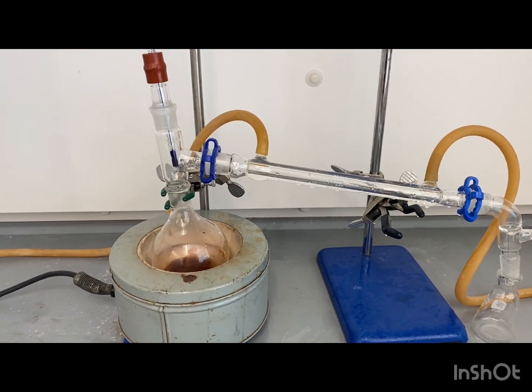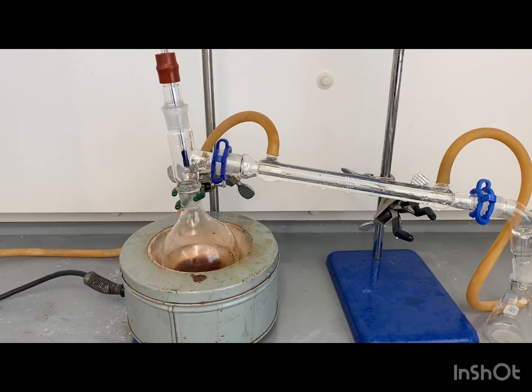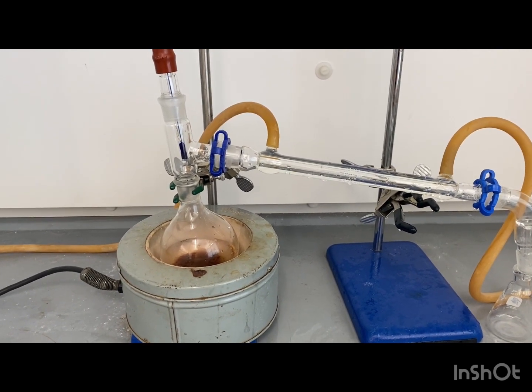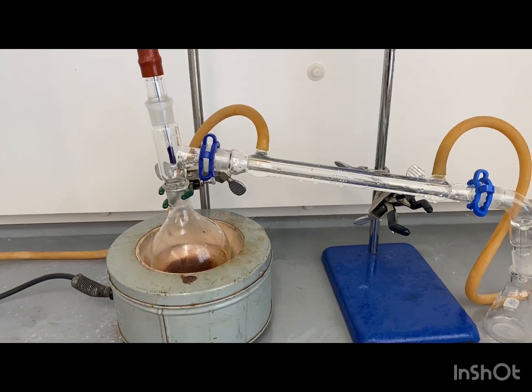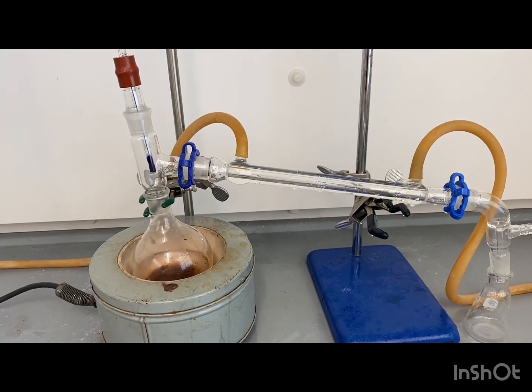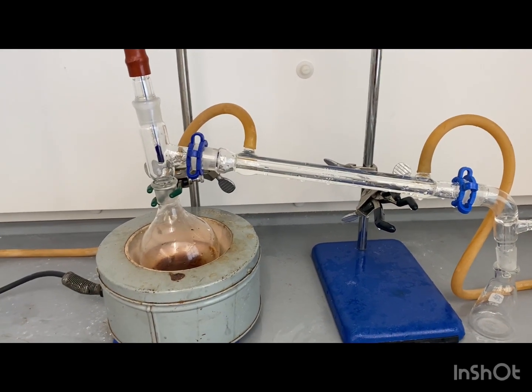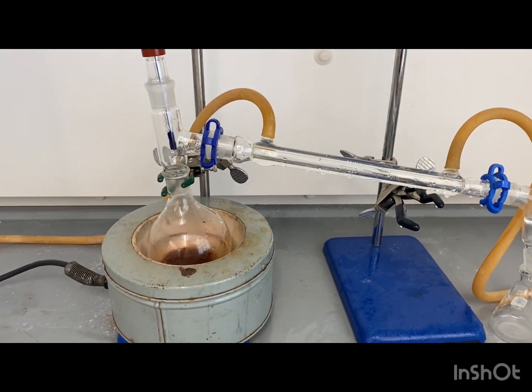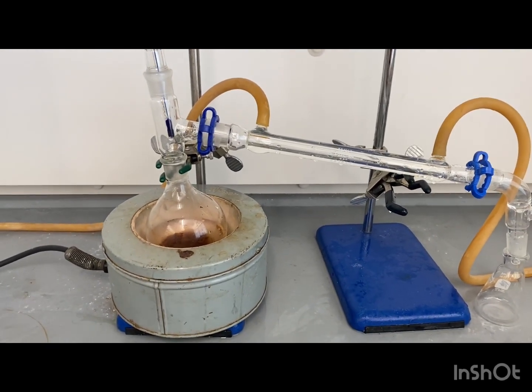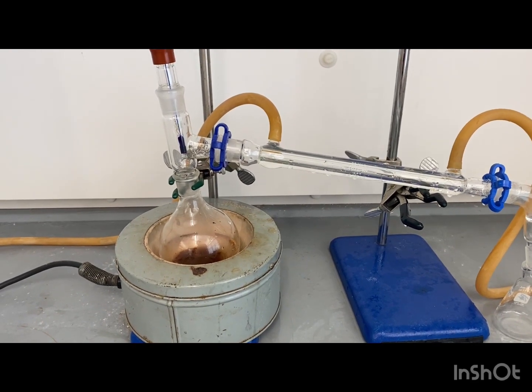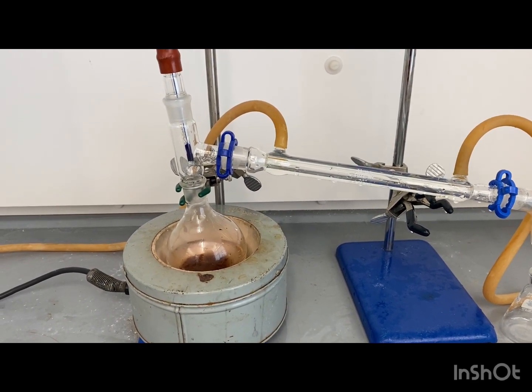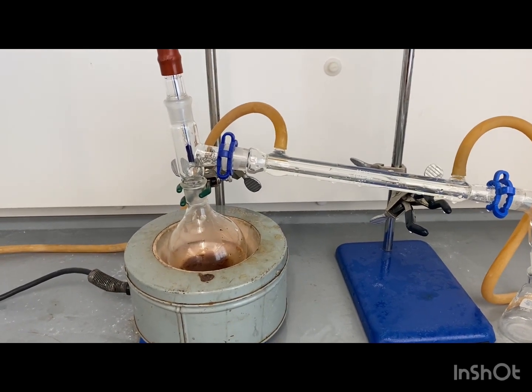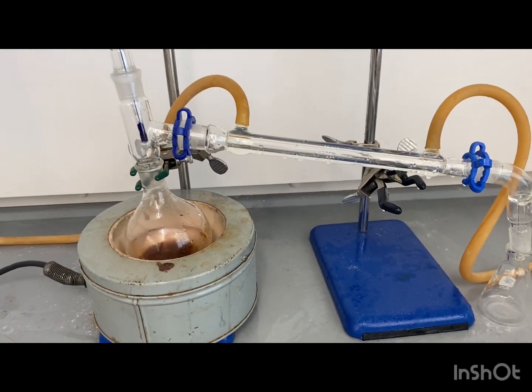We have the water on. We have the heating mantle on. Notice when you're using the ceramic heating mantles, you don't have to use sand. But if you do, just make sure you don't put too much so the heat doesn't get to the round bottom flask. But you just want to watch for boiling again. Make sure it doesn't boil over into the 3-way adapter, into the distillate, into the condenser. If it does, you'll just have to start over.